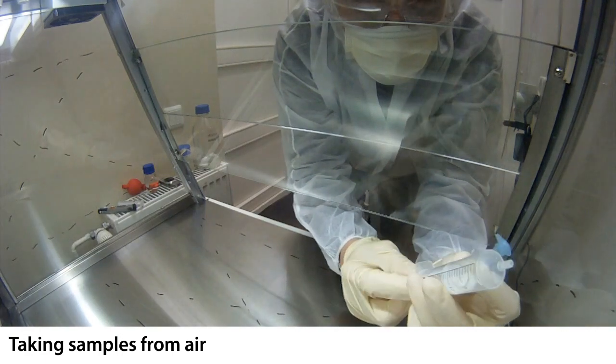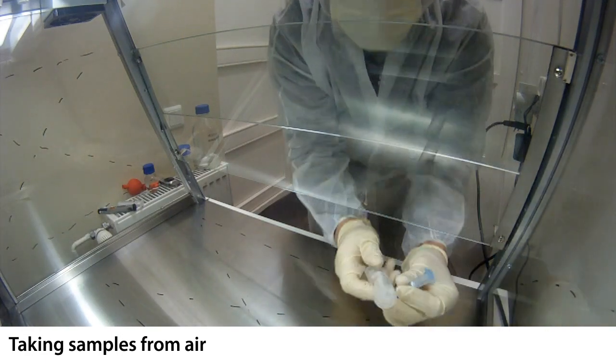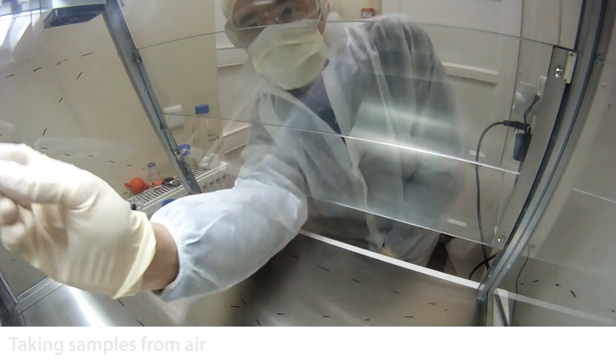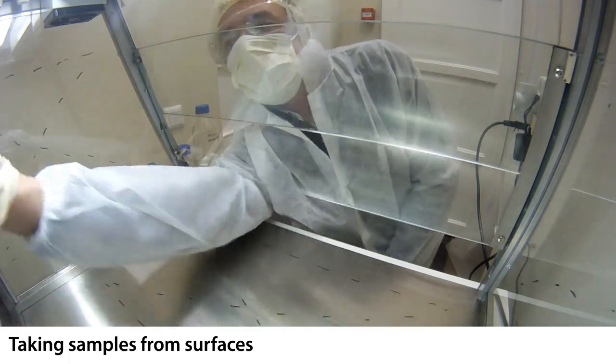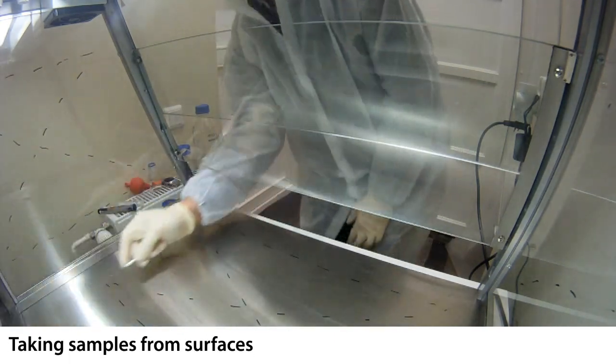Three samples are taken from air with syringes. Four samples are taken from surfaces with smears.